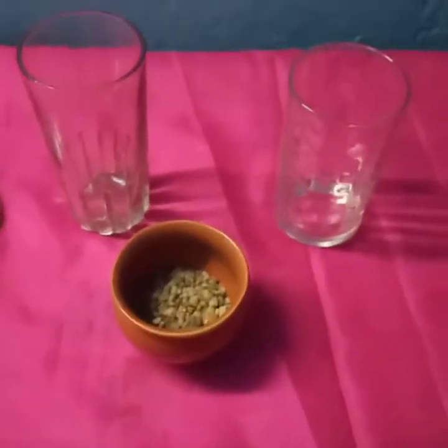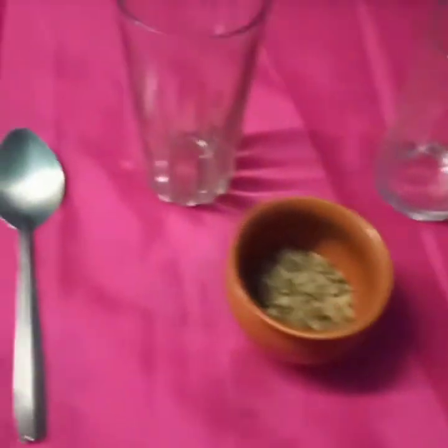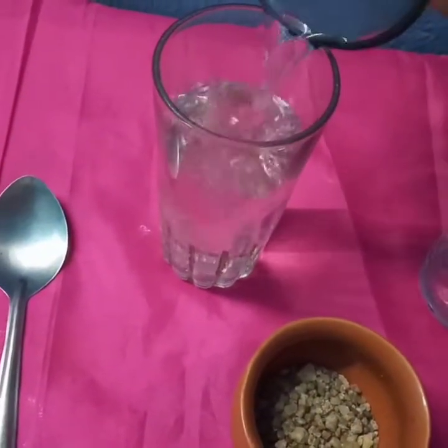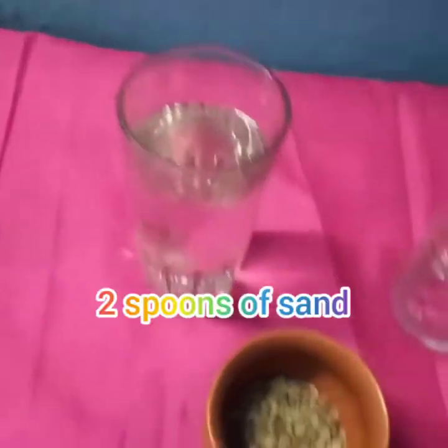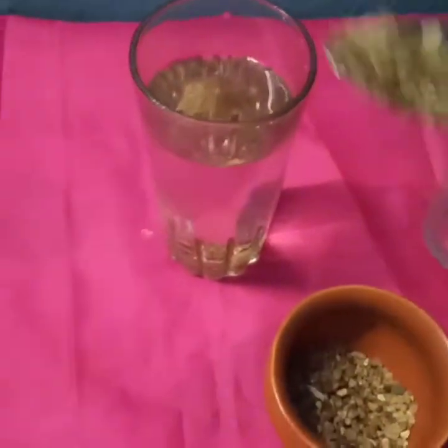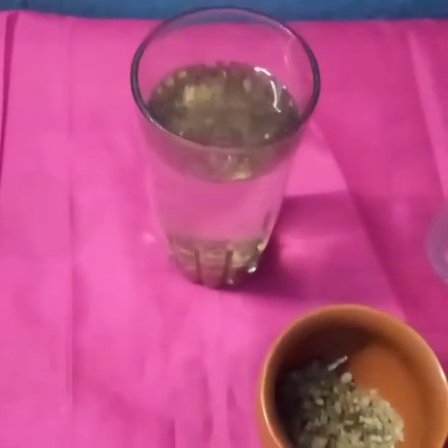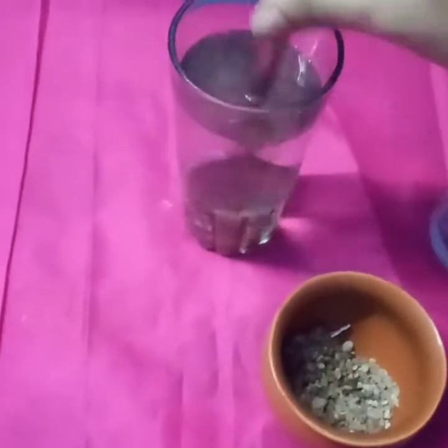Take water in one beaker. So we are taking water in one beaker. Now add 2 spoons of sand in it and stir it. Since I am taking a small amount, let me take some more. But you have to take only 2 spoons of sand, and now stir it. So I am stirring it.